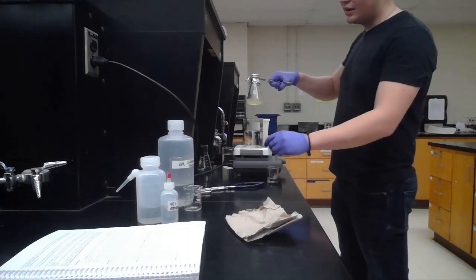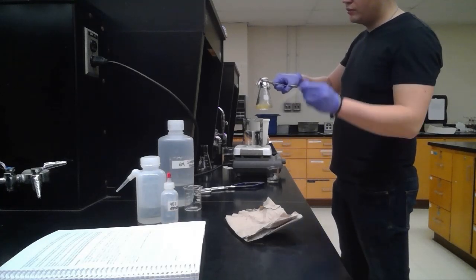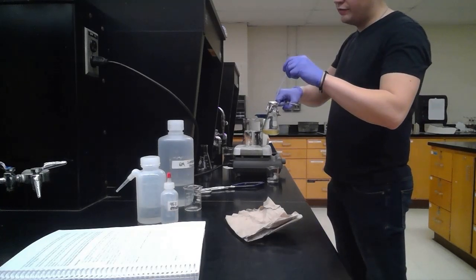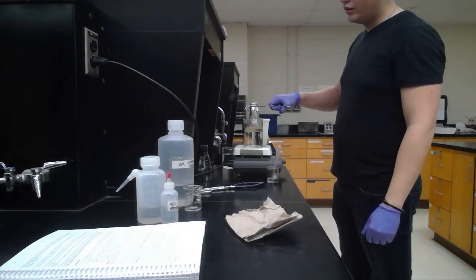It's also important not to let this dry out. So we're going to be topping off the mixture with half ethanol, half DI water. And then we're just going to continue heating it.